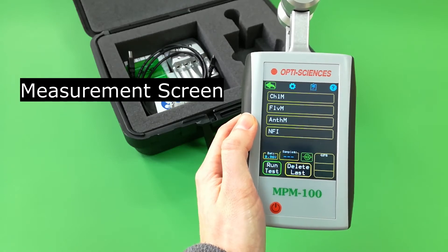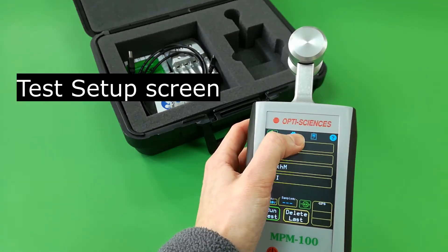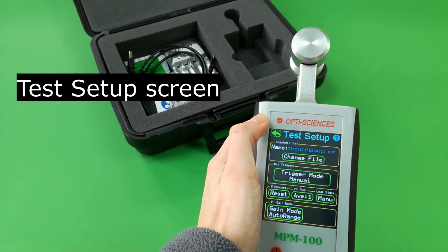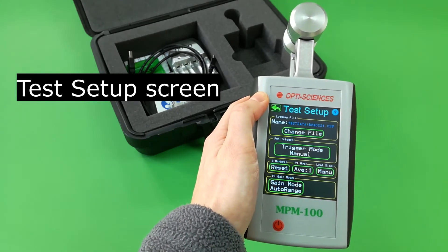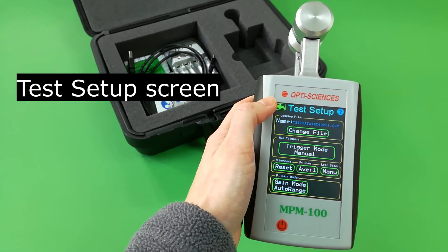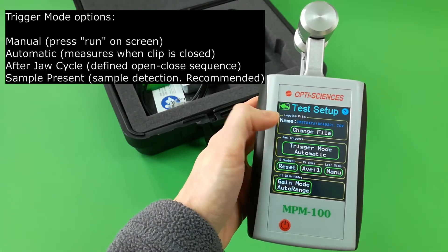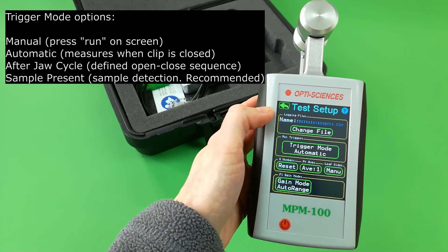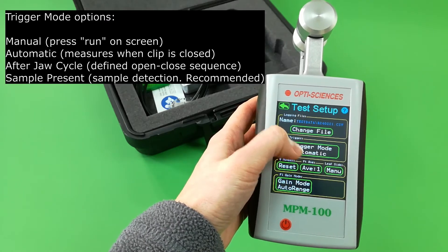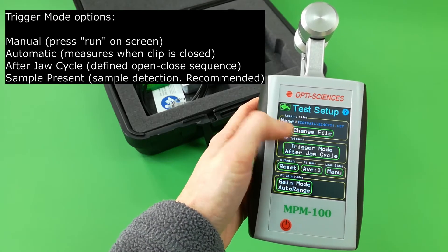From the measurement screen, press the cog icon for test setup. Select the trigger for measurements: either manual, automatic, after jaw cycle, or sample present.